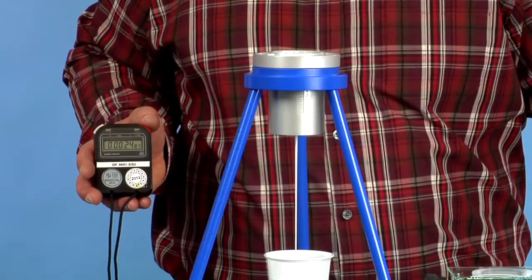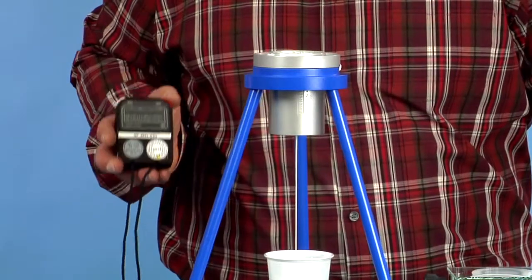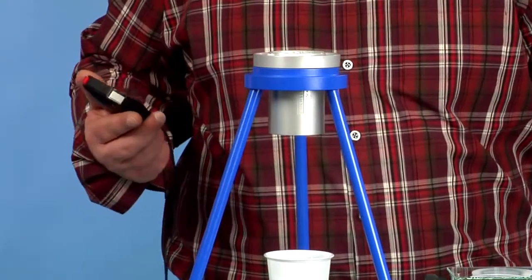Stop the stopwatch as soon as the liquid coating material stream begins to drip. Finished.